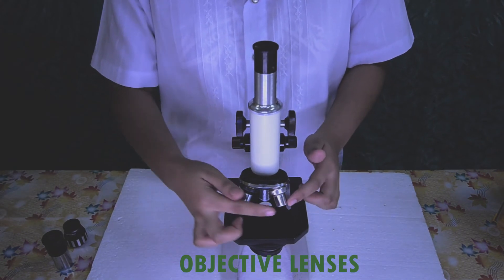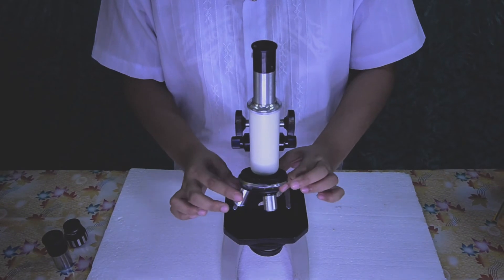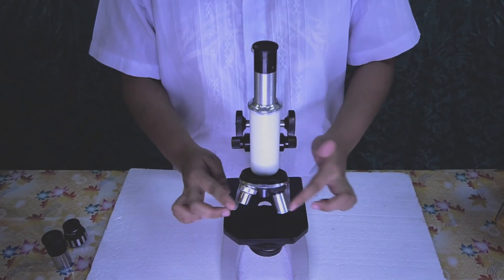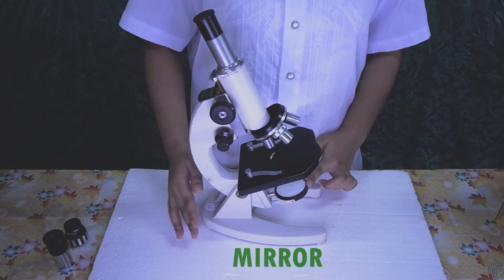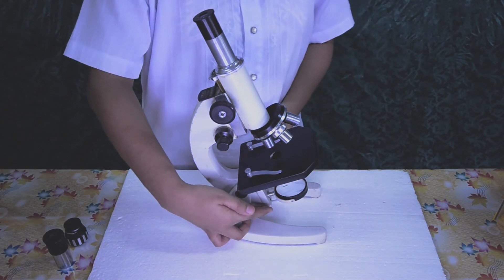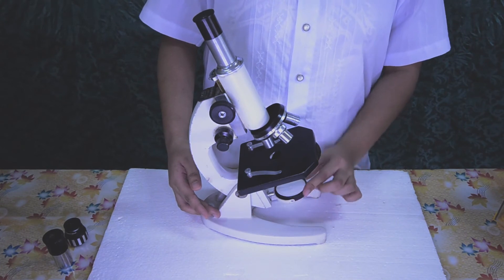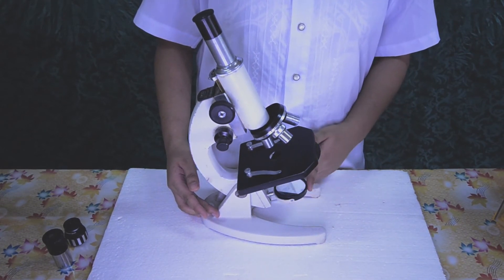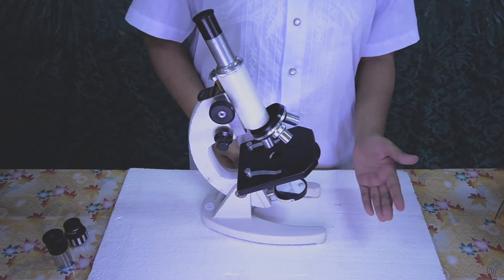Objective lenses. Three objective lenses are attached to the revolving nose piece at the bottom of the body tube. Mirror. It is either attached to the lower end of the arm or to the pillar. It contains a plain mirror on one side and a concave mirror on the other side. The mirror is used to reflect light rays into the microscope.